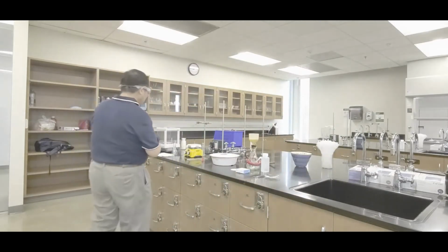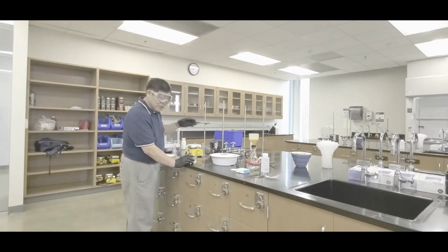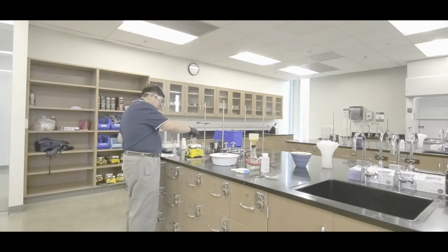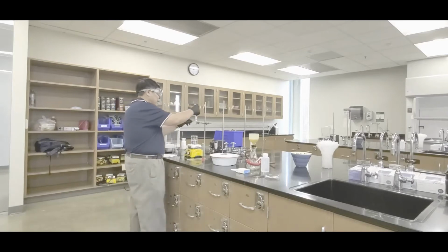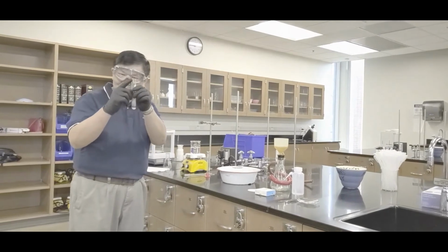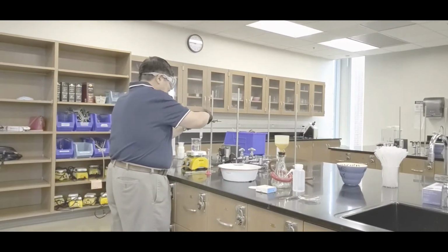Hey, you guys notice that nothing's plugged in, okay? That's for safety purposes. Don't turn anything on until you finish with the setup, okay? So here you go, you park the beaker with the water like that, and then here's the test tube. What you want to do is clamp it on the clamp. Oh, by the way, it should have a lip, the test tube. That way it can sit safely on the clamp.